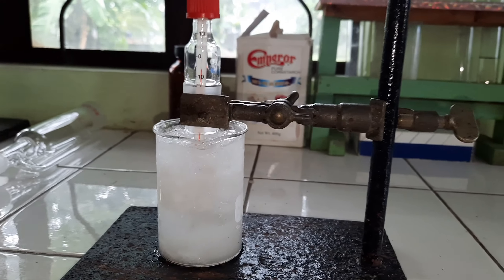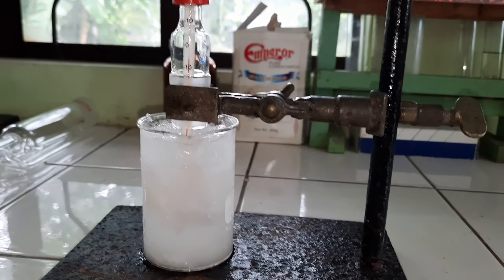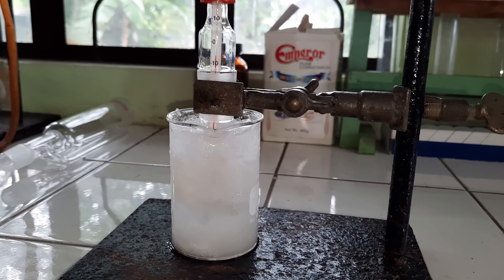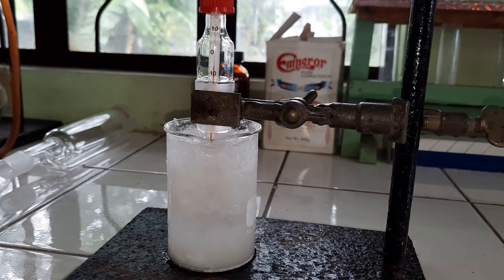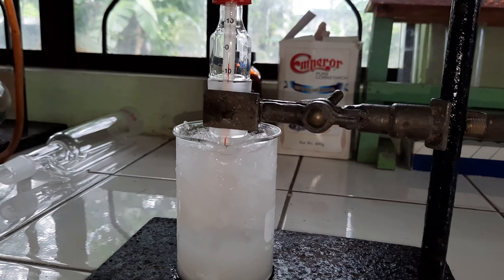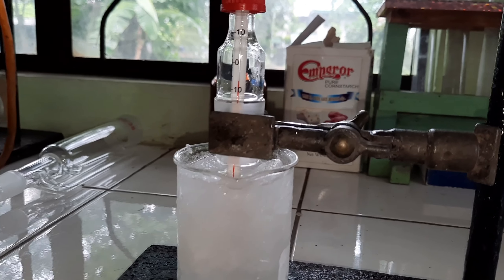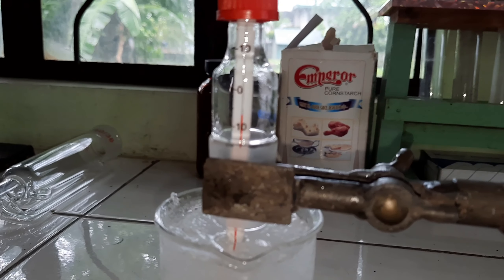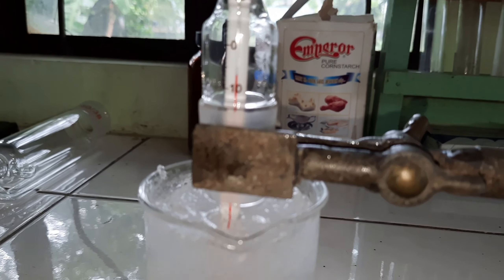It's going negative 6 at this point. See the effect of sodium chloride on the freezing point of water.